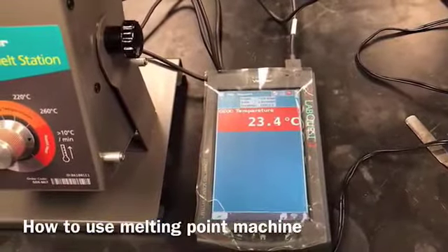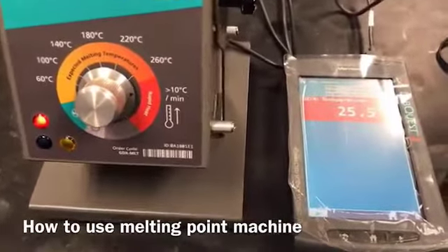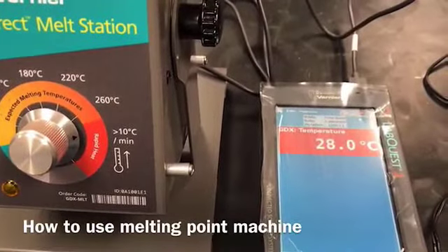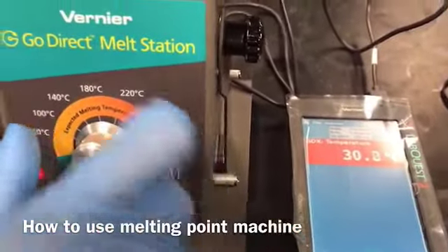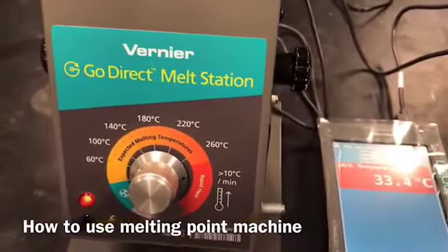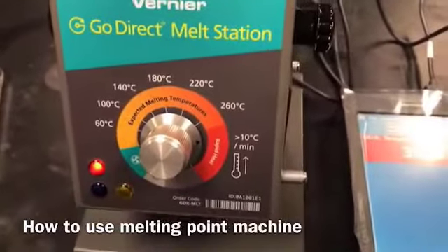Now, I already mentioned the melting point of sulfanilamide is 164.5 to 166.5 degrees centigrade, right? When I see my temperature come around 135 or 140, I would decrease the rate of rising the temperature and set it up around 170 so that I will not miss my sulfanilamide melting point, and the heating should not be very fast, so that it will be difficult for me to record the melting point, right?